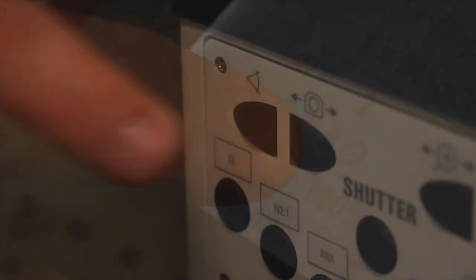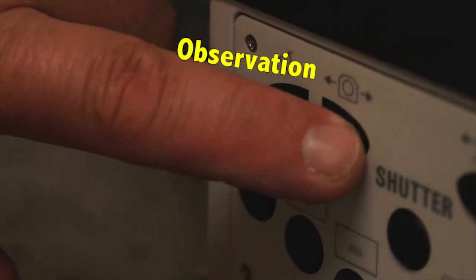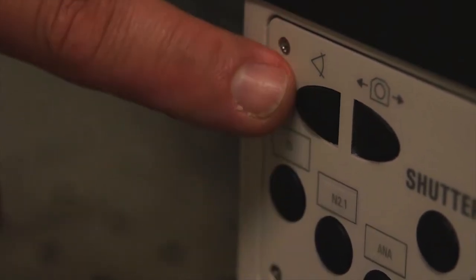We will show you momentarily how to look down the tube of the microscope to know where your aperture diaphragm should be set. On the front panel of the microscope are two buttons that direct the light to observation or to the camera, which is built into the side of the microscope. You shouldn't be manipulating these buttons unless you need to do photography right off the microscope. The second to the last line on the screen shows the beam path and whether it's directed to the camera or for observation. And so by actuating the observation camera button, you can see that 100% is directed to observation or 100% is directed to the camera.